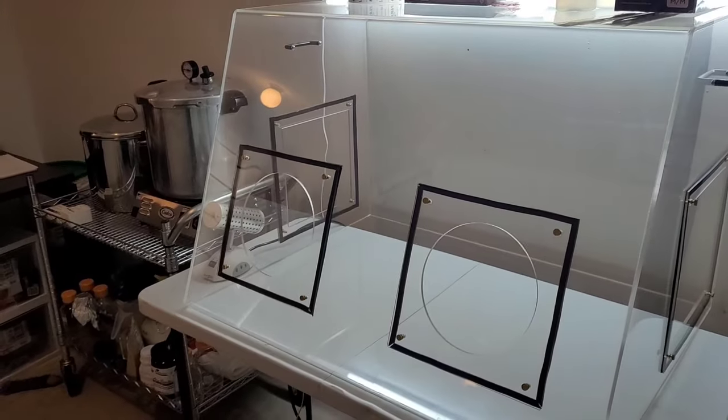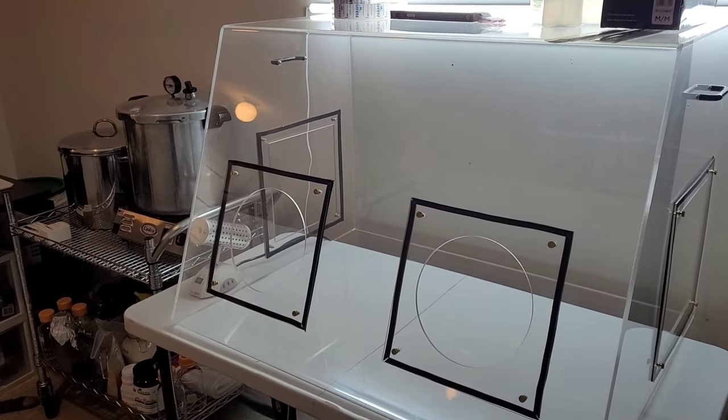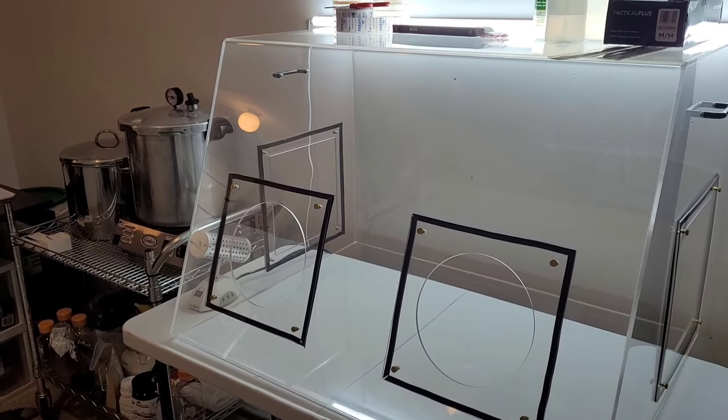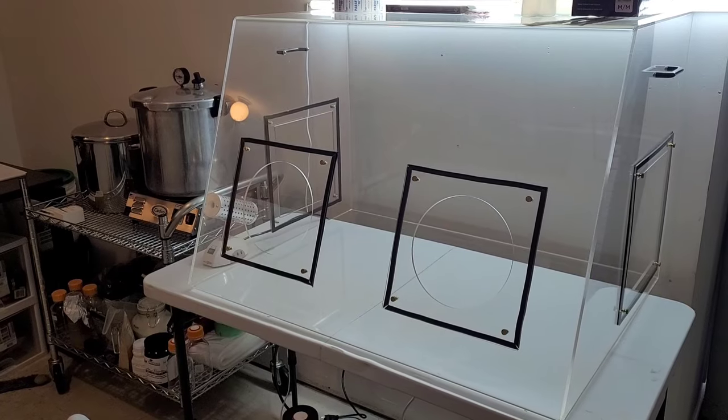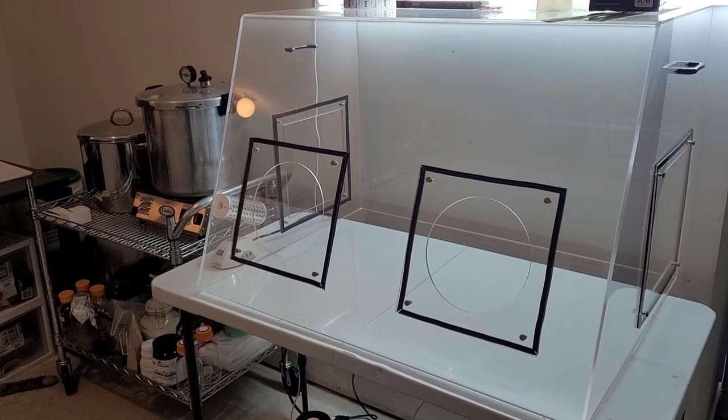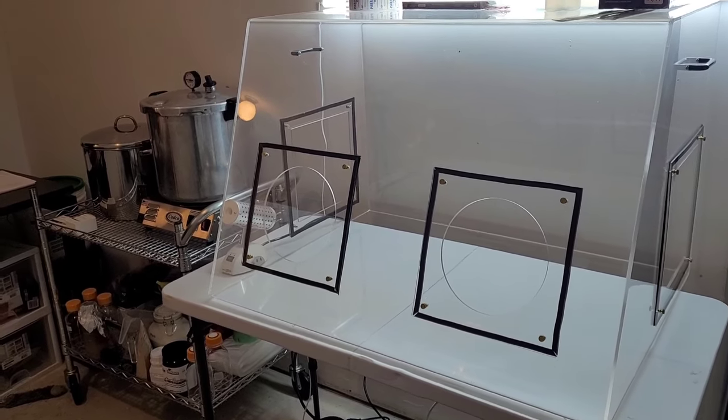I attempted to fill this with smoke the other day to show how still the air actually becomes inside of your still air box. The smoke is just sitting there perfectly still. It's not moving at all. So as you can see, there is no movement whatsoever until you take the covers off and then begin moving around in there.